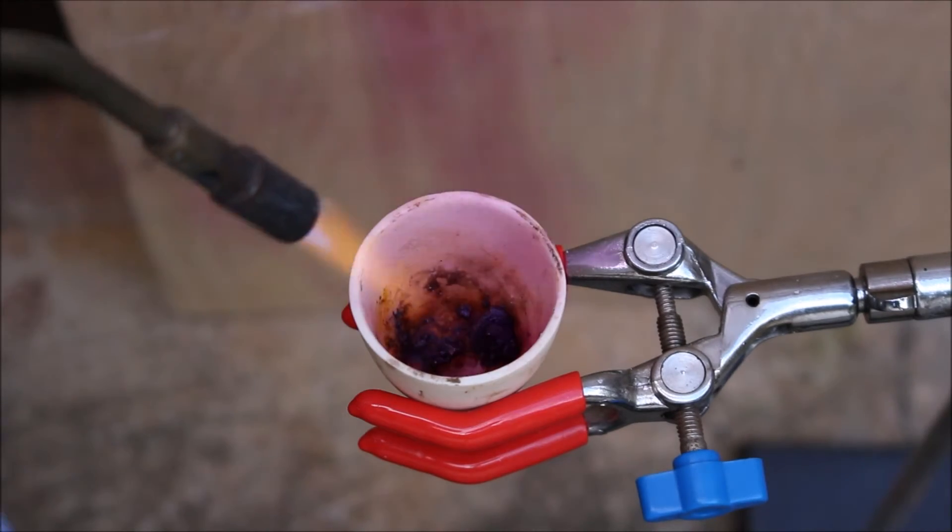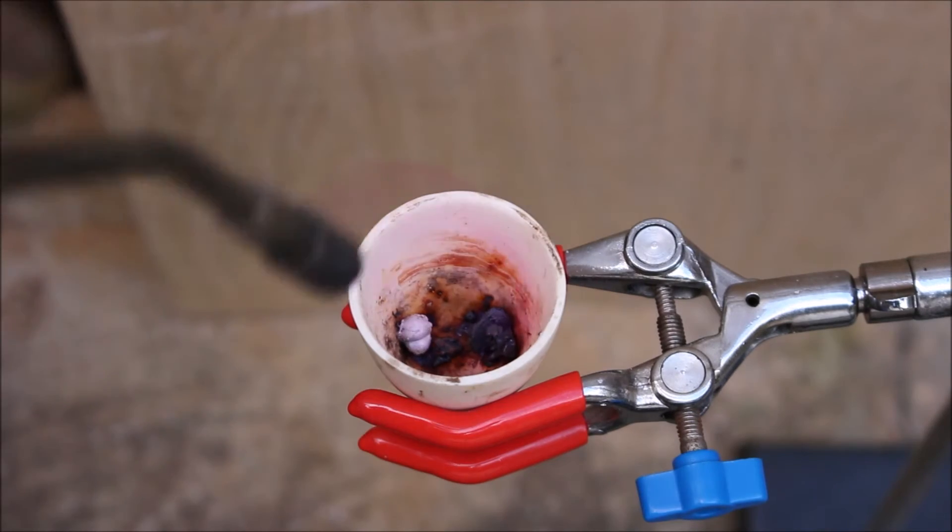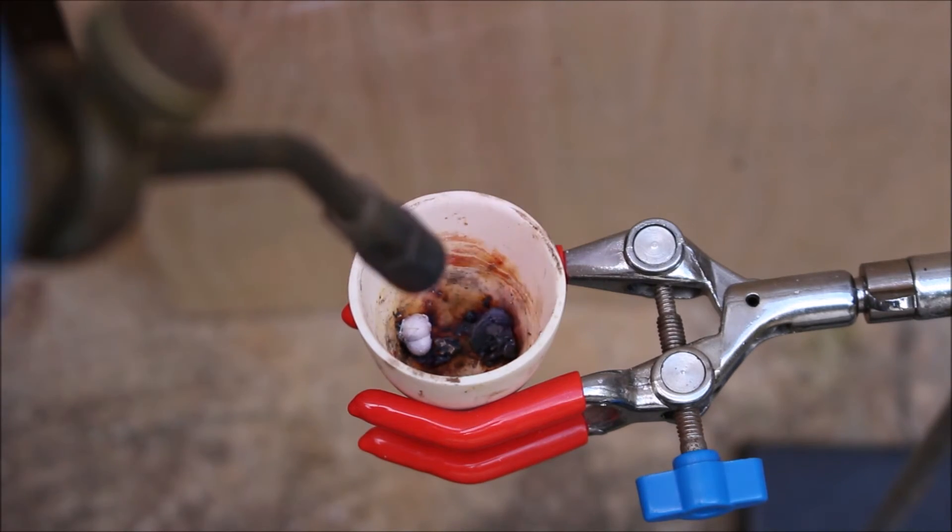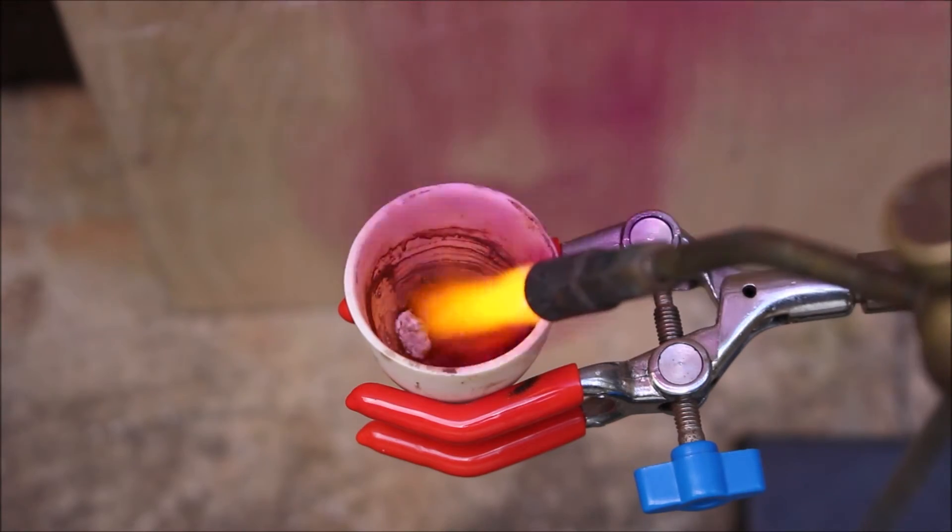Some purple smoke. It's smoking, but it's not a reaction.